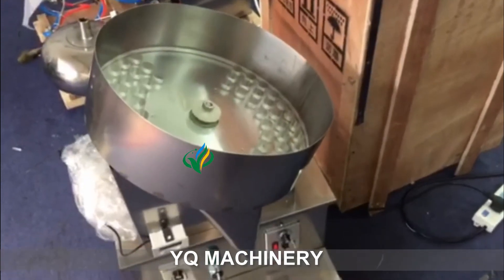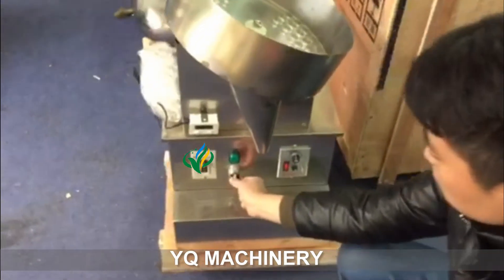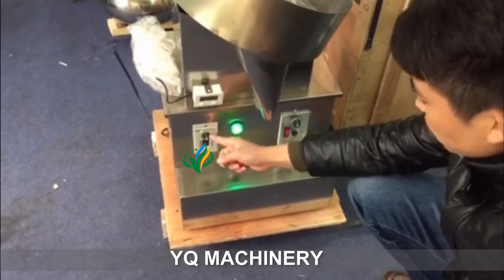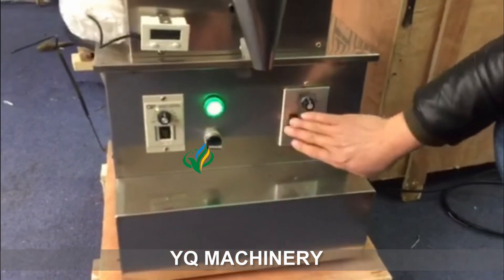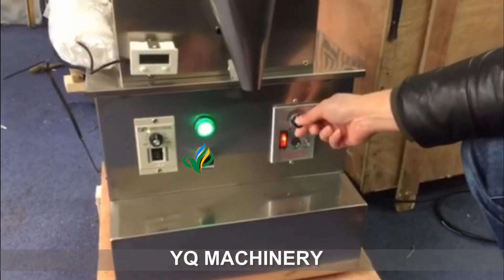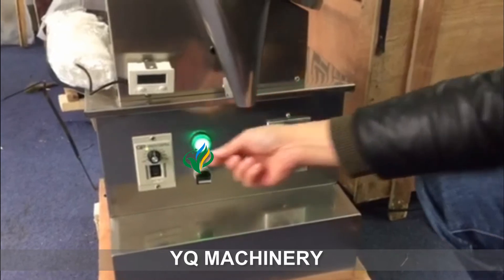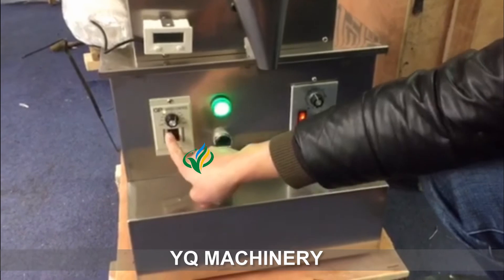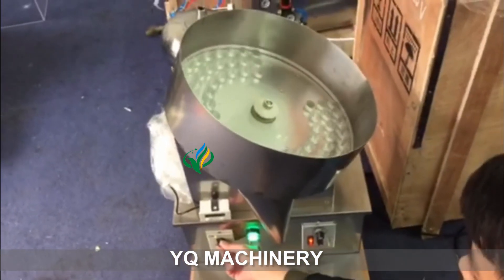The power here. Open this one. This is the control speed. This is the shake. This can adjust like this. The speed can adjust to here. Then it's turn and turn.